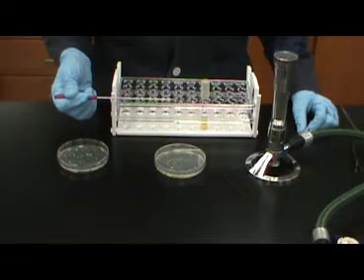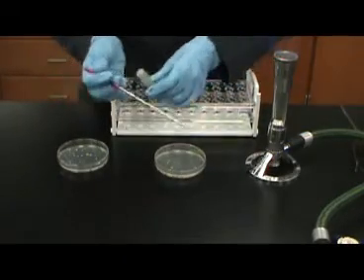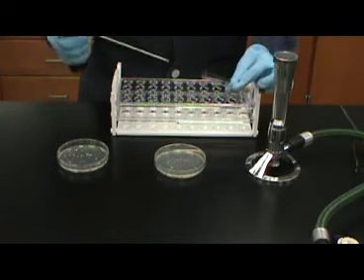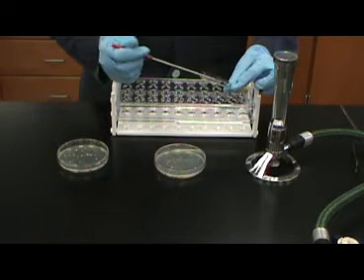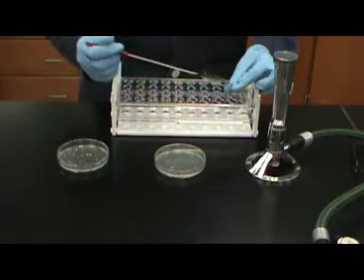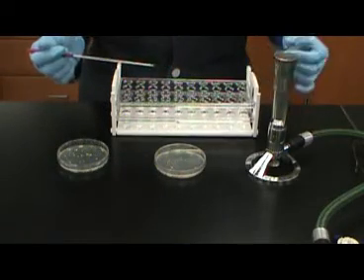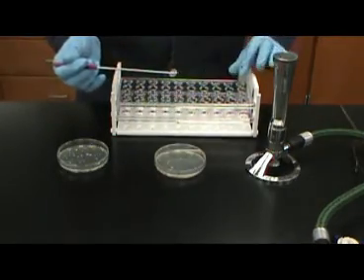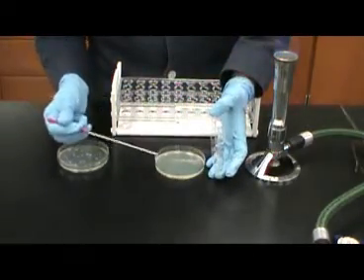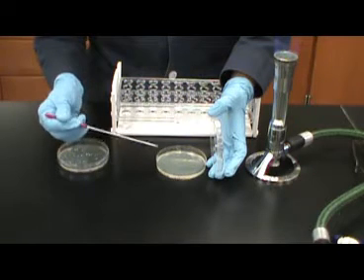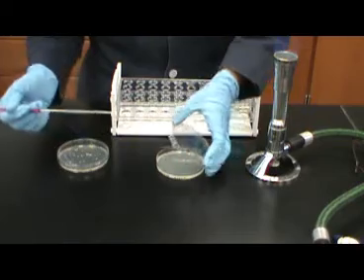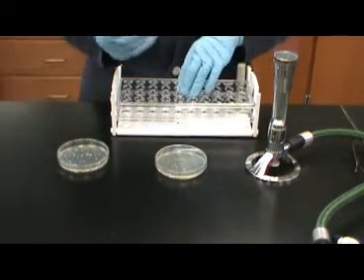Inoculate one-third of the plate. Flame your loop.